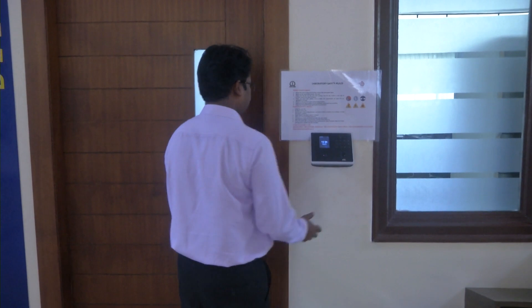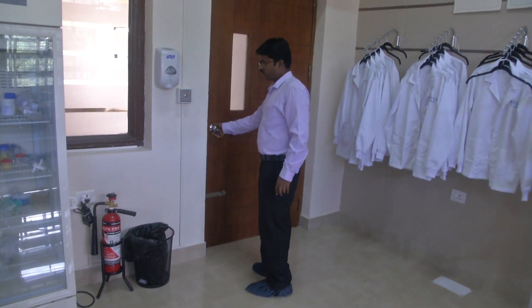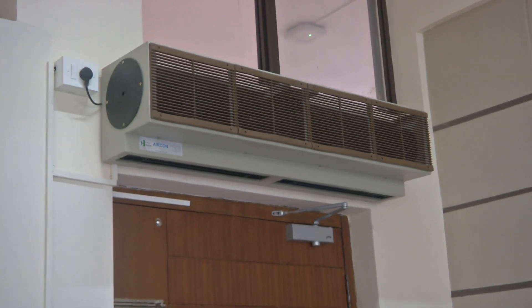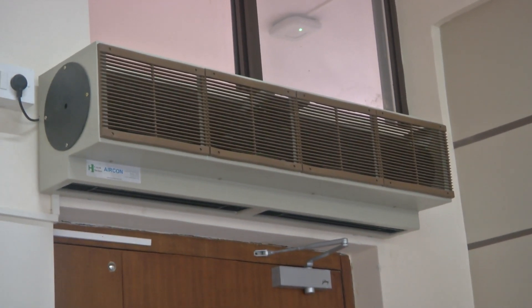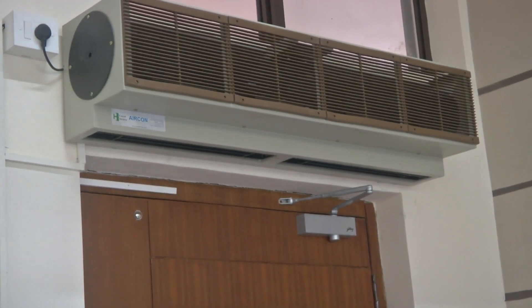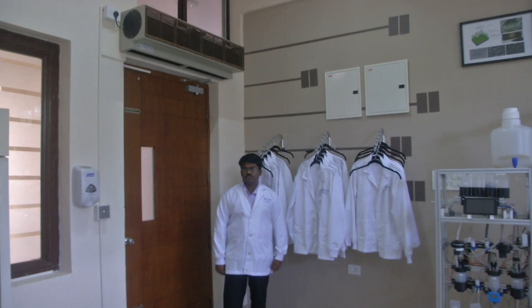After wearing the shoe covers, he enters the clean room after reading the laboratory safety protocols on the right side, which clearly state the mandatory protocols to be followed before entering. Once he gets access, he opens the clean room door and shuts it. The noise you heard in the clean room is from the air curtain on top, which flows air at around 10 meters per second — this ensures that particulate count is restricted to that area to reduce contamination or dust entering inside the clean room.